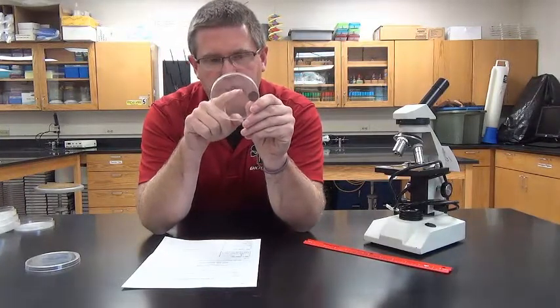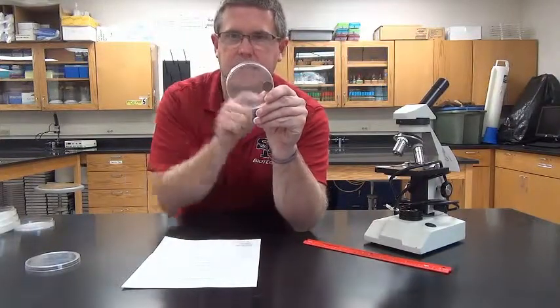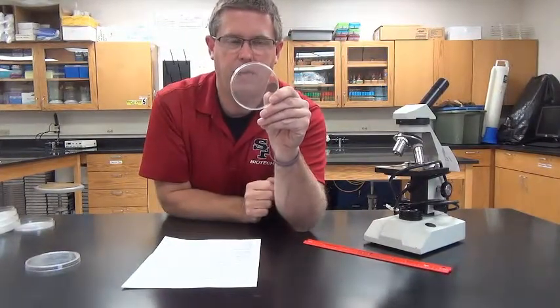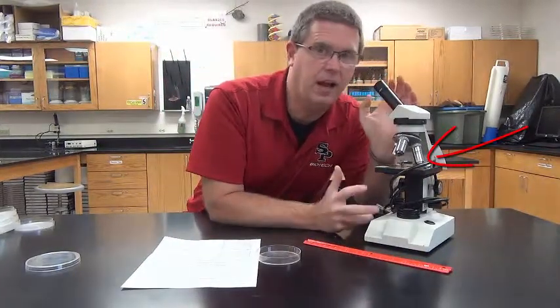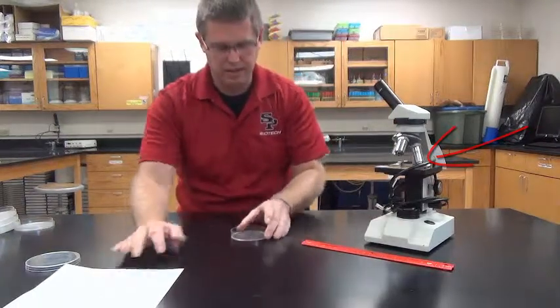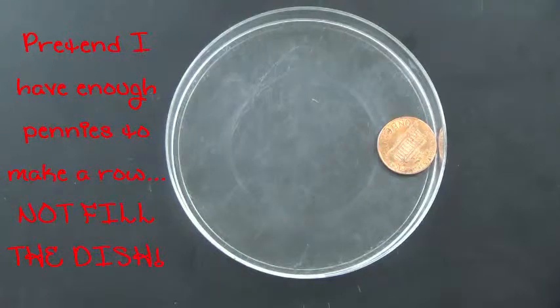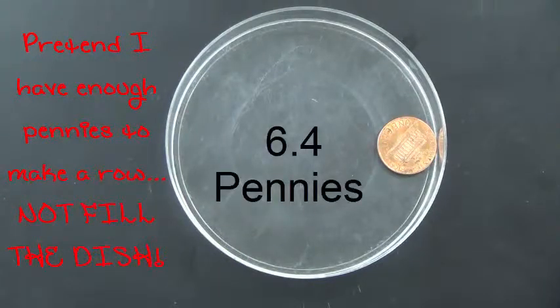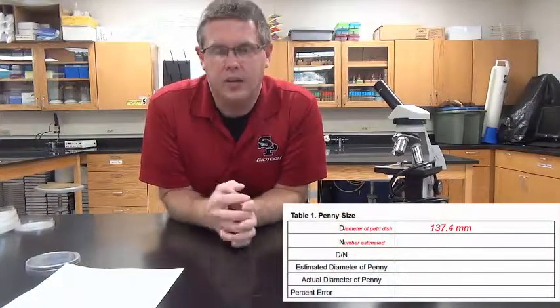As I go across, I go 1, 2, 3, 4. I just use my mind's eye. I can't touch it as I'm going across, because I'd be as if I'm looking down a microscope and making an estimate. So I set it on the table, put the penny down, and just look at it. I use my mind's eye and come up with 1, 2, 3, 4, 5, 6, 6.4 pennies to get from one side to the other of the dish. Next step, I write that on the worksheet.